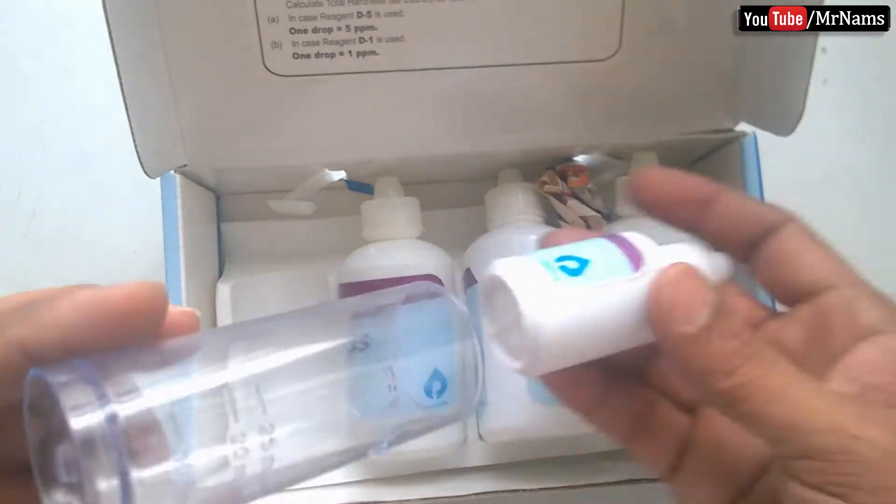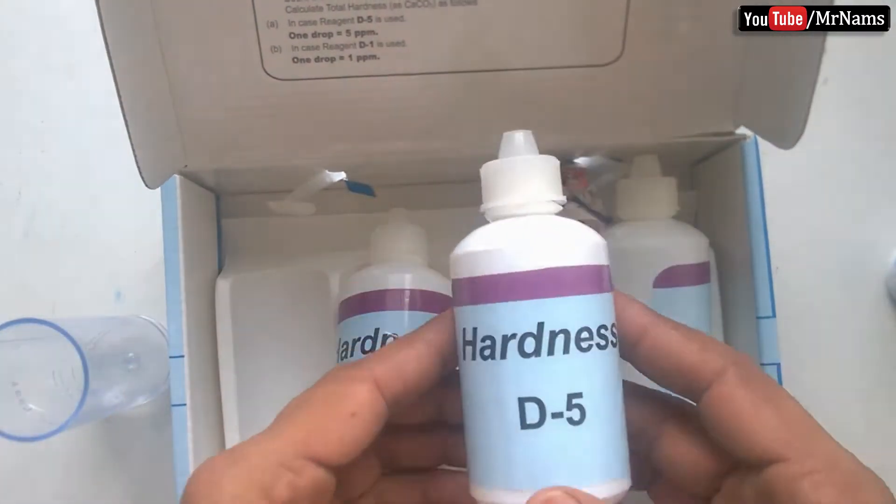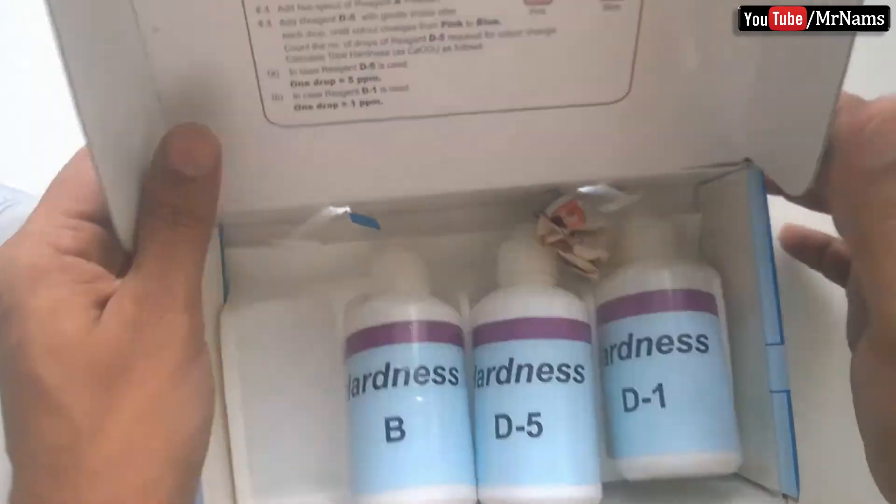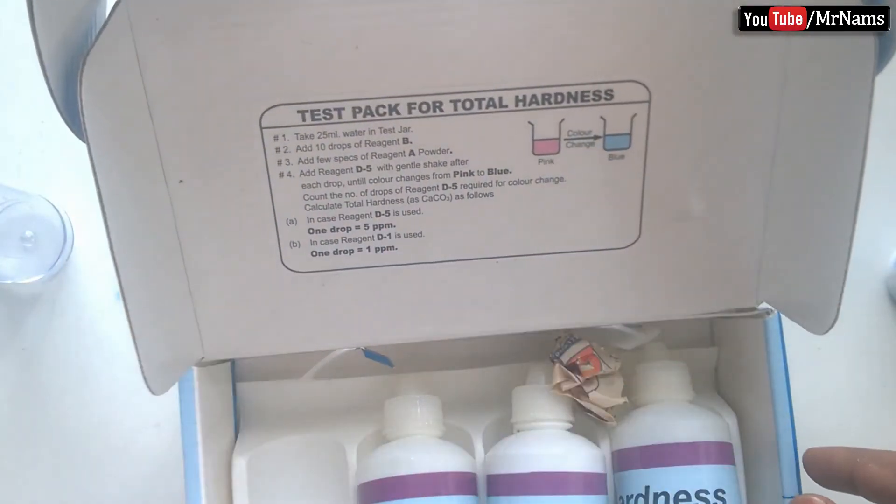These are different reagents. It's very simple to measure hardness, just follow these instructions.